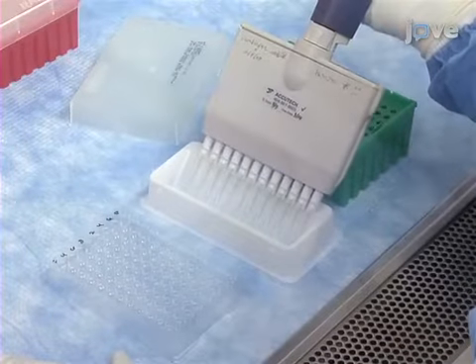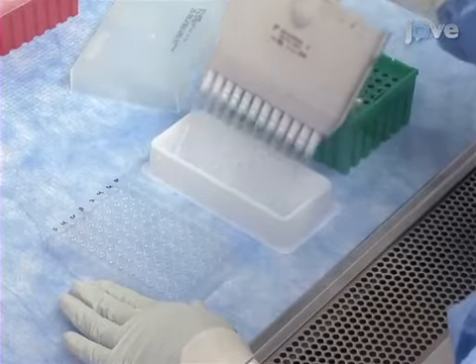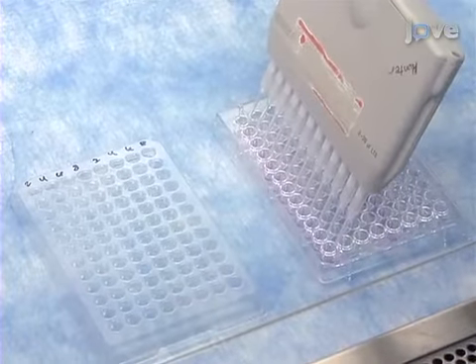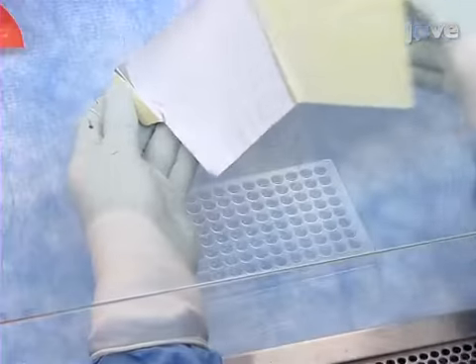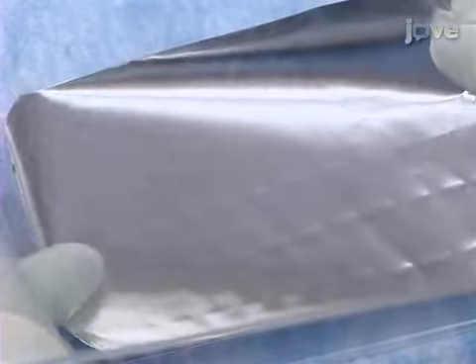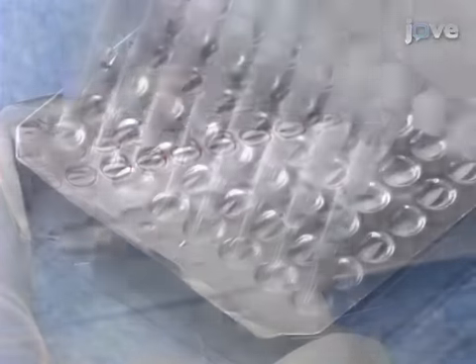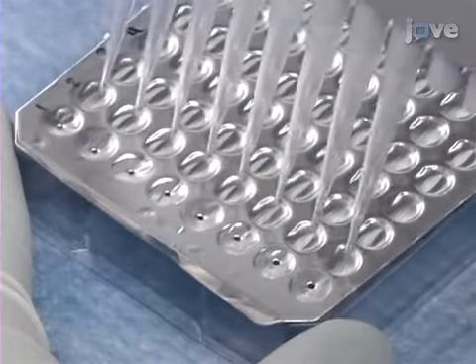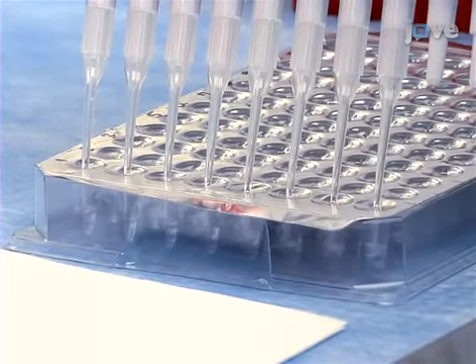Next, dispense 25 microliters of labeled RT mix into each well of a 96-well thin-walled PCR plate. Add 5 microliters of each supernatant to the PCR plate containing the RT master mix. Then, seal the PCR plate with an adhesive foil cover and incubate for 2 hours at 37 degrees Celsius in a thermocycler. After incubation, make small holes in the foil cover using a 200 microliter multi-channel pipette. Mix the samples 5 times.